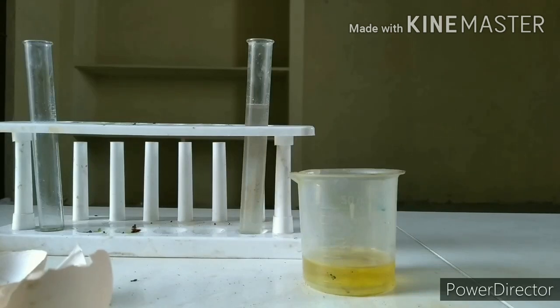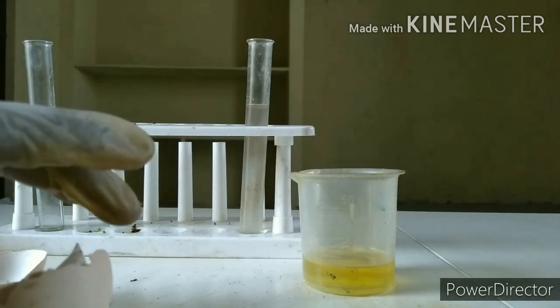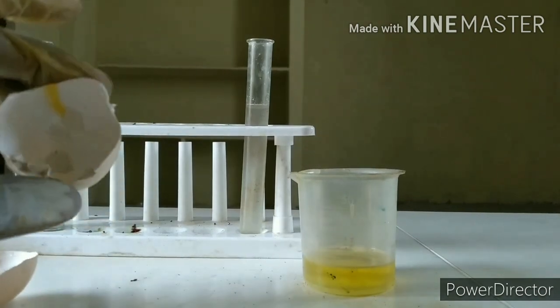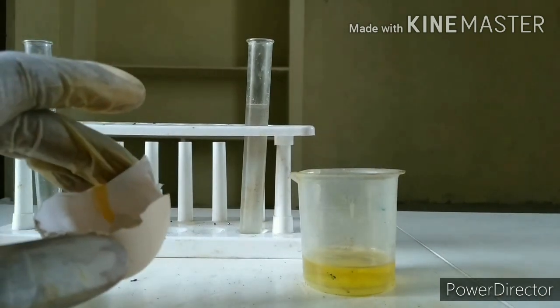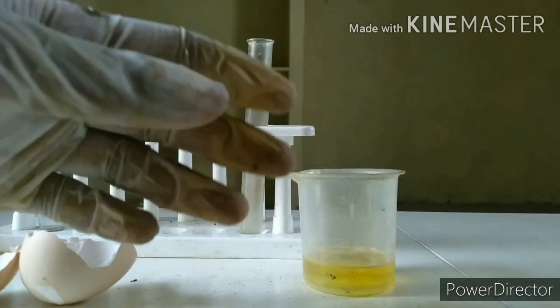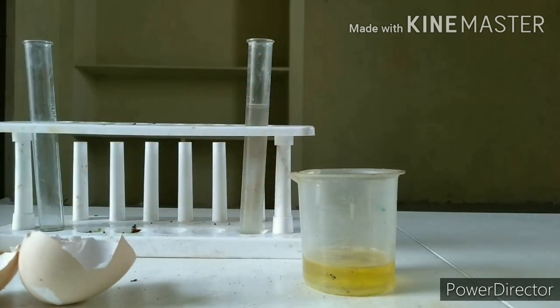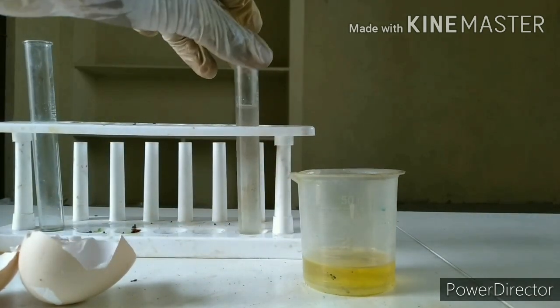How's it going everyone? I'm El and I'm going to be showing you how you can make calcium hydroxide out of eggshells, calcium carbonate. Better put on these gloves and also work in a very well-ventilated place and a safe place to do these chemical experiments.